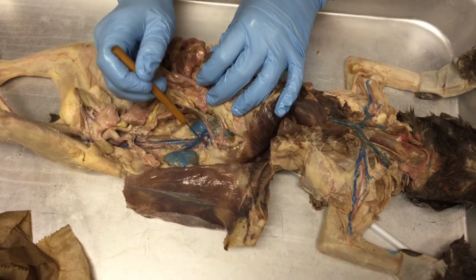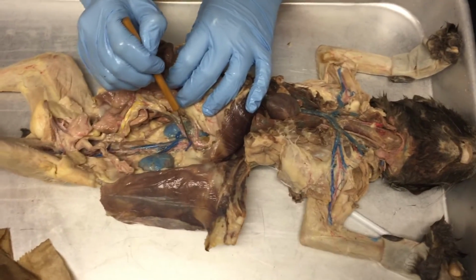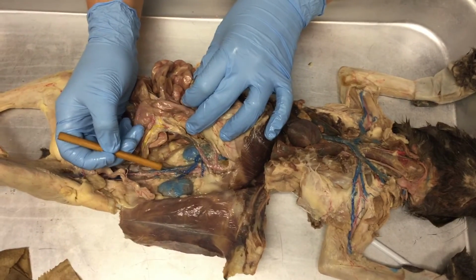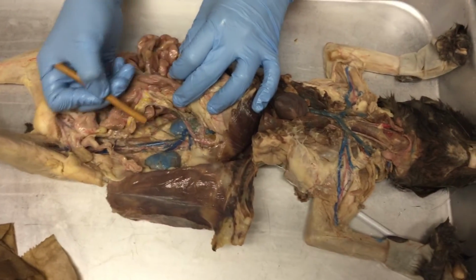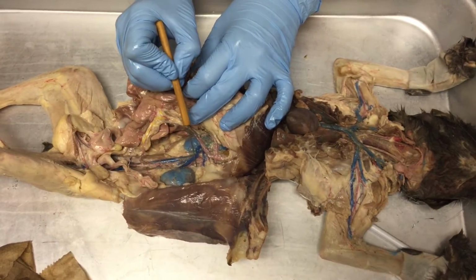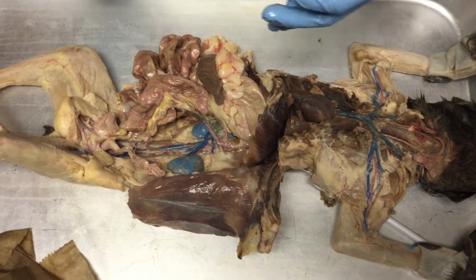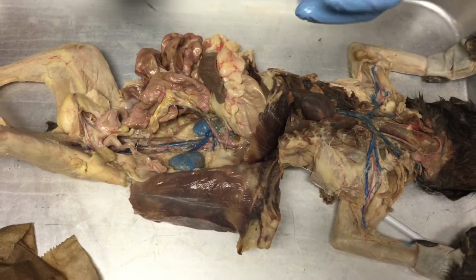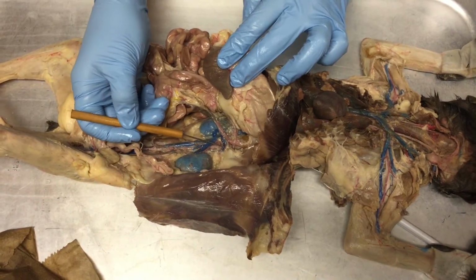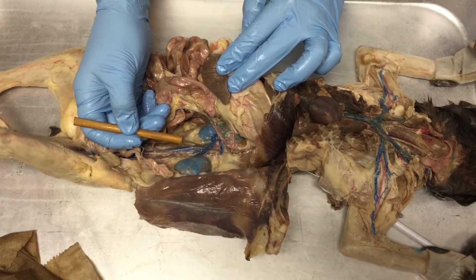This right here, it's really hard to see the artery below it because I didn't tease it away very well, but this blue vein coming from this structure right here, what do you think this is? Is that the pancreas? Adrenal gland. Yeah, so the adrenal gland is real grainy and it just looks like a bunch of crap on top of the kidney. But this right here is the adrenal gland, and this vessel right here is the adrenolumbar vein.